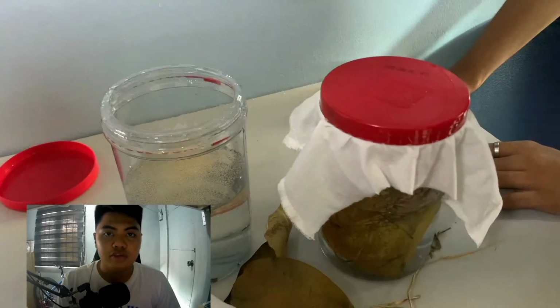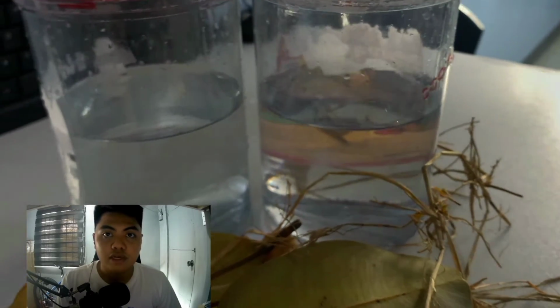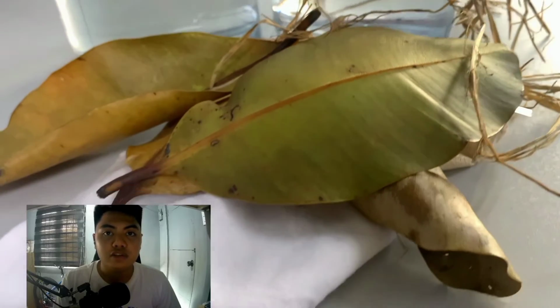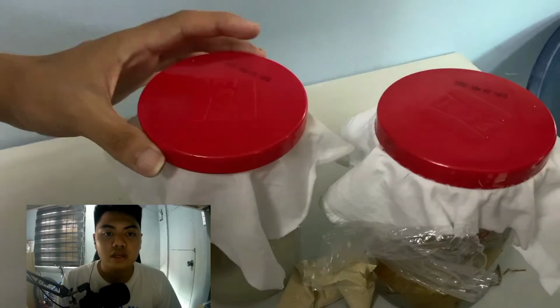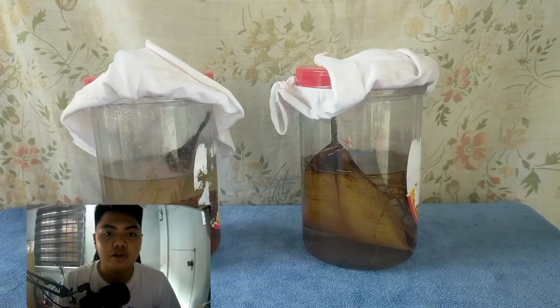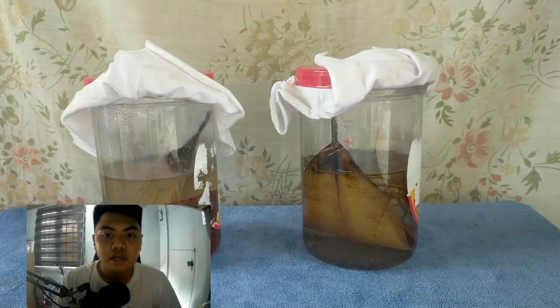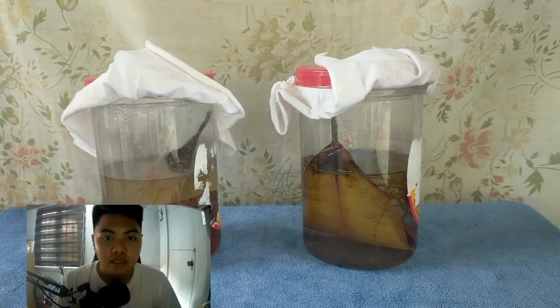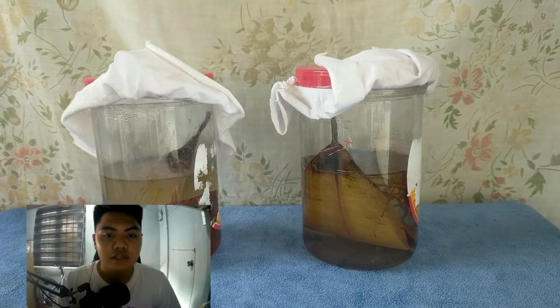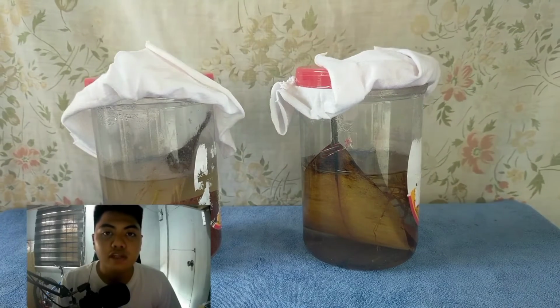Why did we include the yeast? The small fungi known as yeast grow swiftly and feed on the nutrients of the decomposing grass. The yeast is a fantastic source of nourishment for the protozoa. After that, add a clean white cloth and cover the top of the container tightly, with a rubber band around it, so that no other organisms can pass through it. Place it in a closed area as it is going to be smelly. Next, let everything rest for a minimum of 2 weeks so the protists can form and start their asexual reproduction.